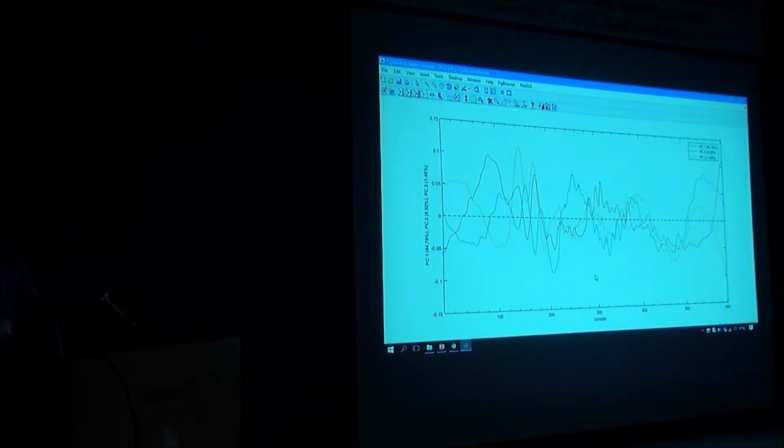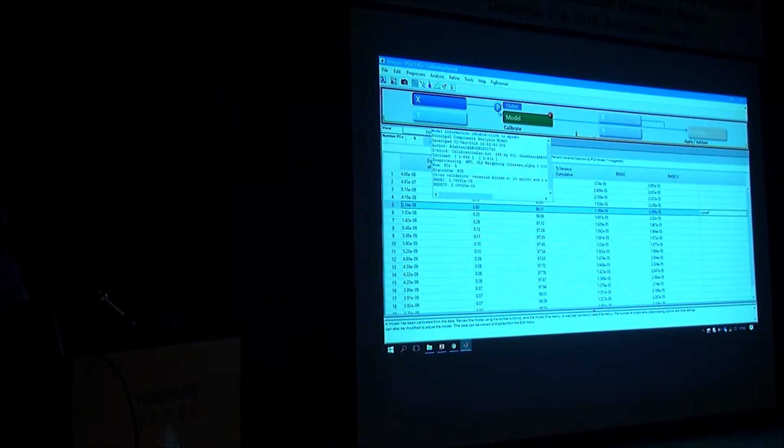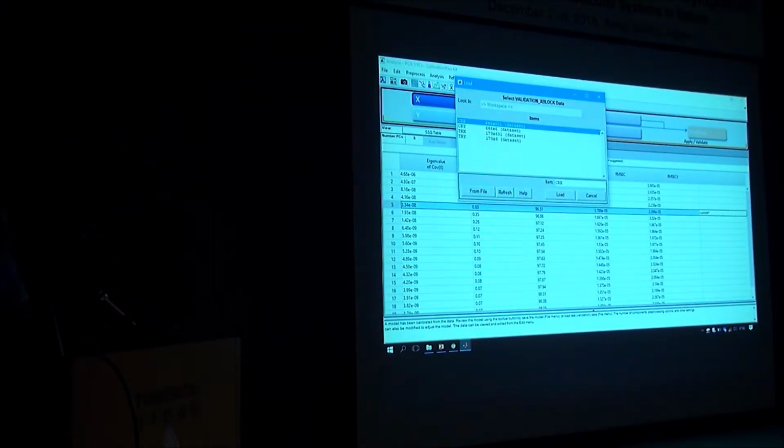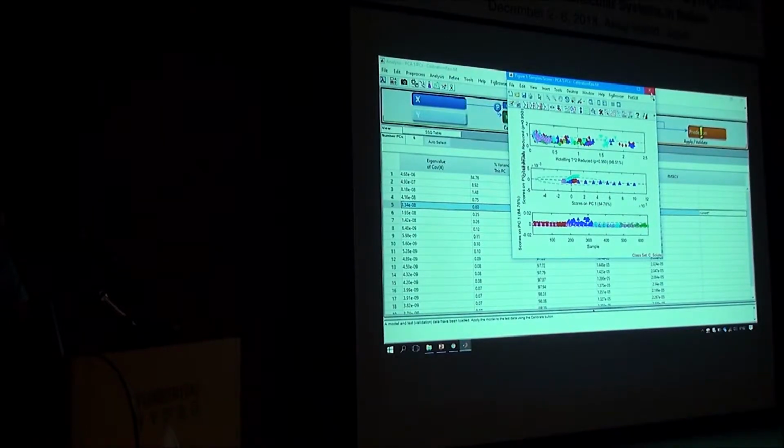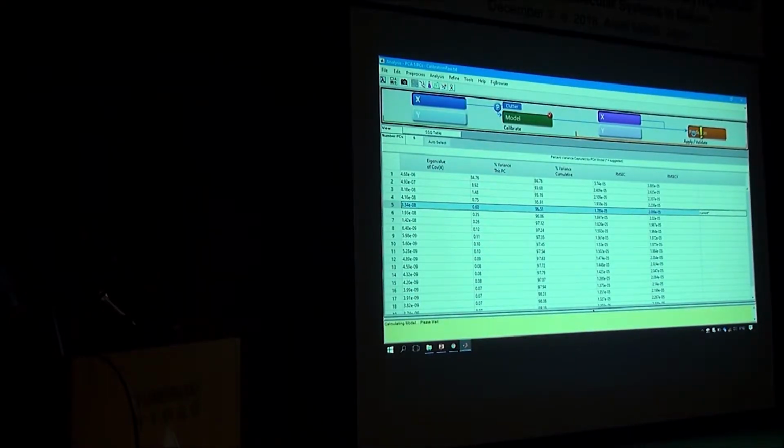How much time do we have? Now we could test the test set. See how this model works on the data you haven't seen before. Let's close this. So we load test spectra. And we say predict. Just close this one. So predict based on PCA. So it projects the new data into the old space after applying the same pre-processing that was applied on the calibration set.